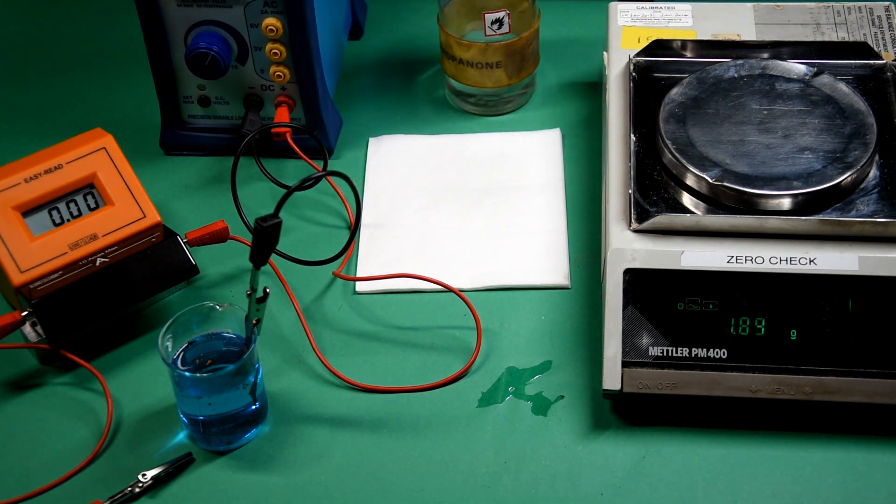The anode has lost approximately 0.25 of a gram.